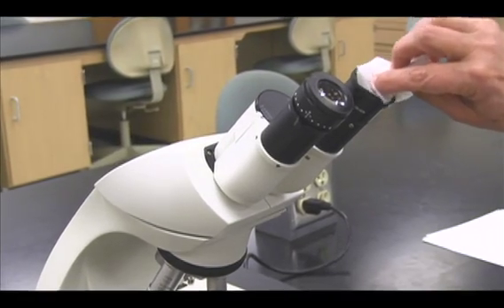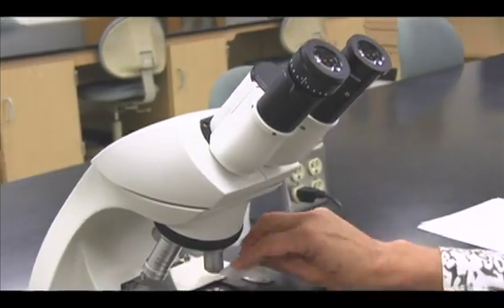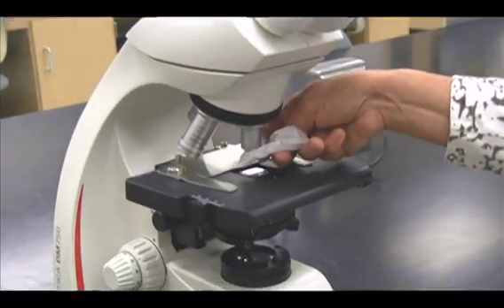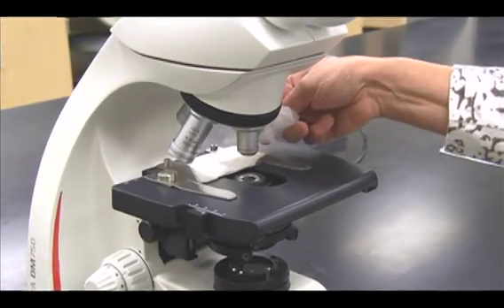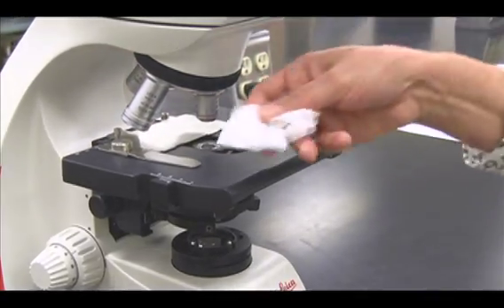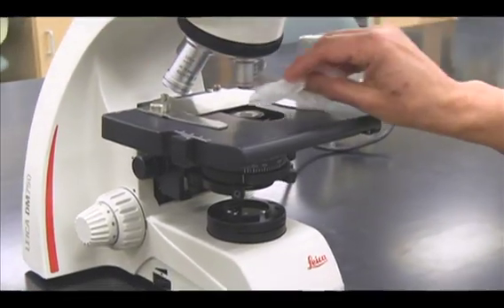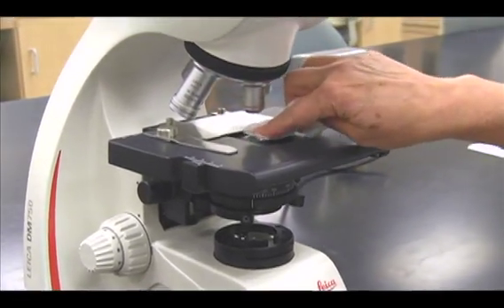Clean the oculars, objectives, condenser, and illuminator with lens paper.